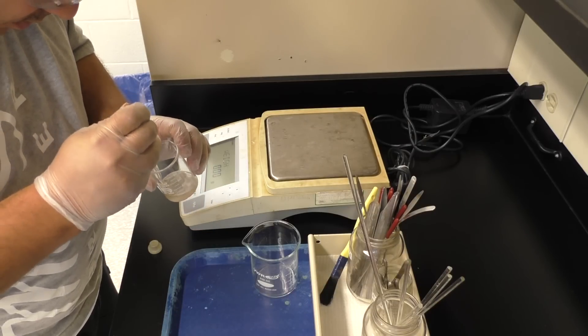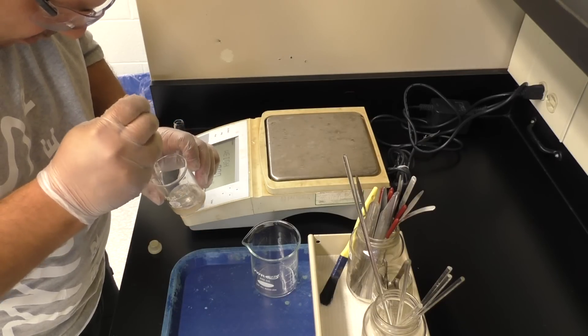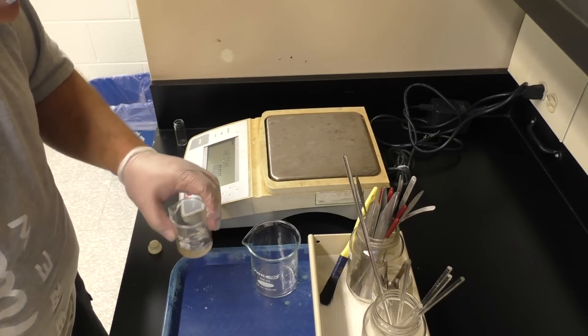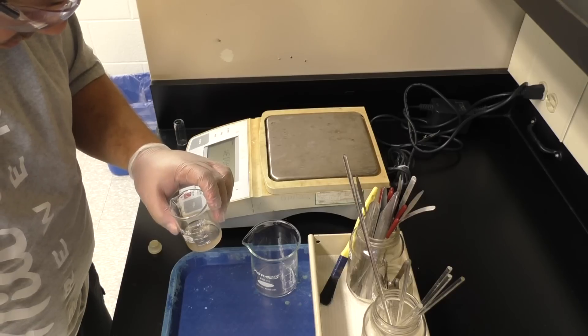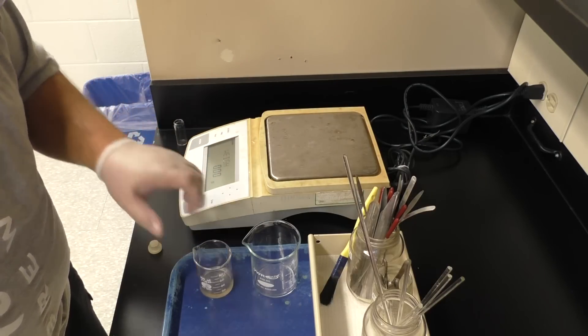If some of it's not breaking up, you can use your pipette now that you don't need to get any fresh ether. Use your pipette into your solution to try and agitate it by taking up some solution and squirting it back in, add any of the chunks that you have, and then give that some time to dissolve.